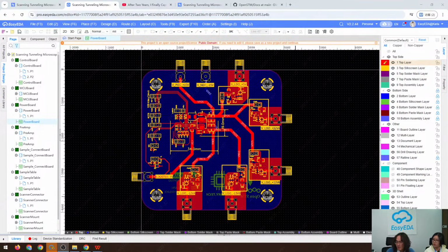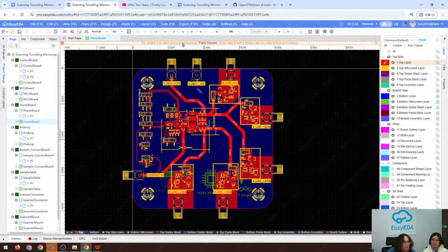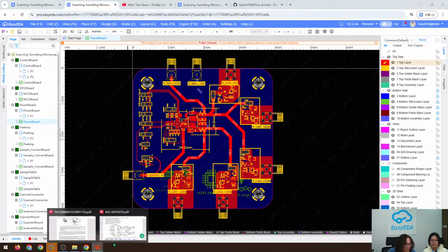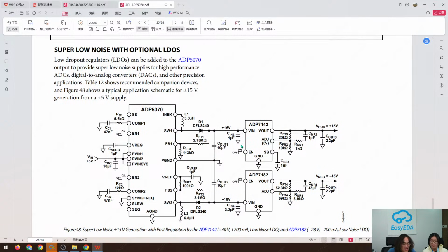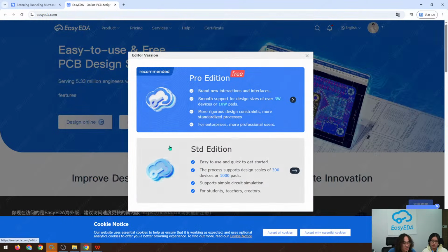And welcome back. So let's continue our PCB drawing. As mentioned before, we are going to reference this typical application circuit, and go online and choose the Pro Edition.